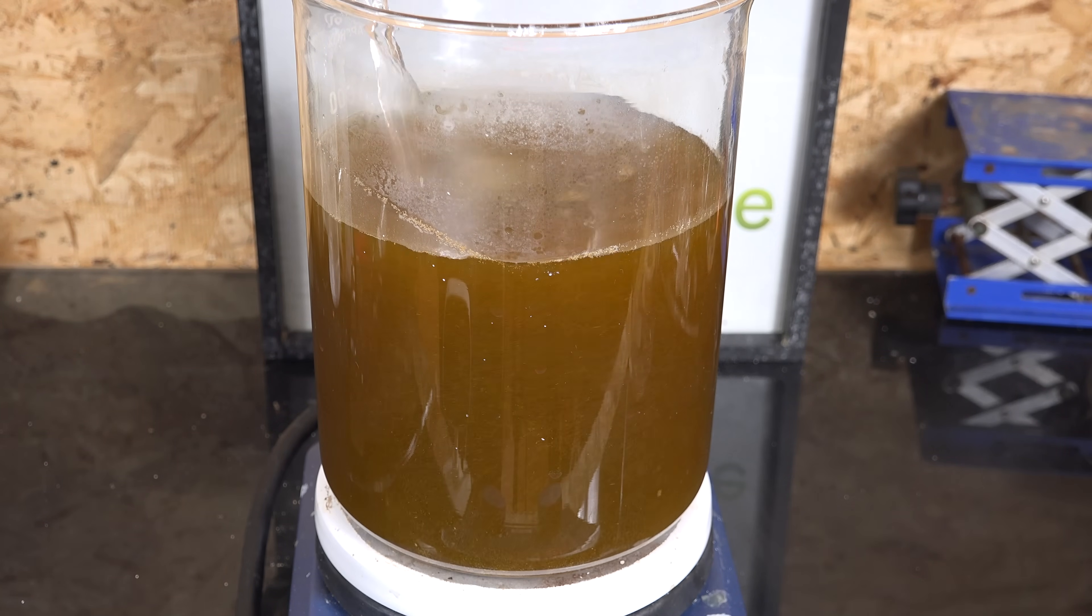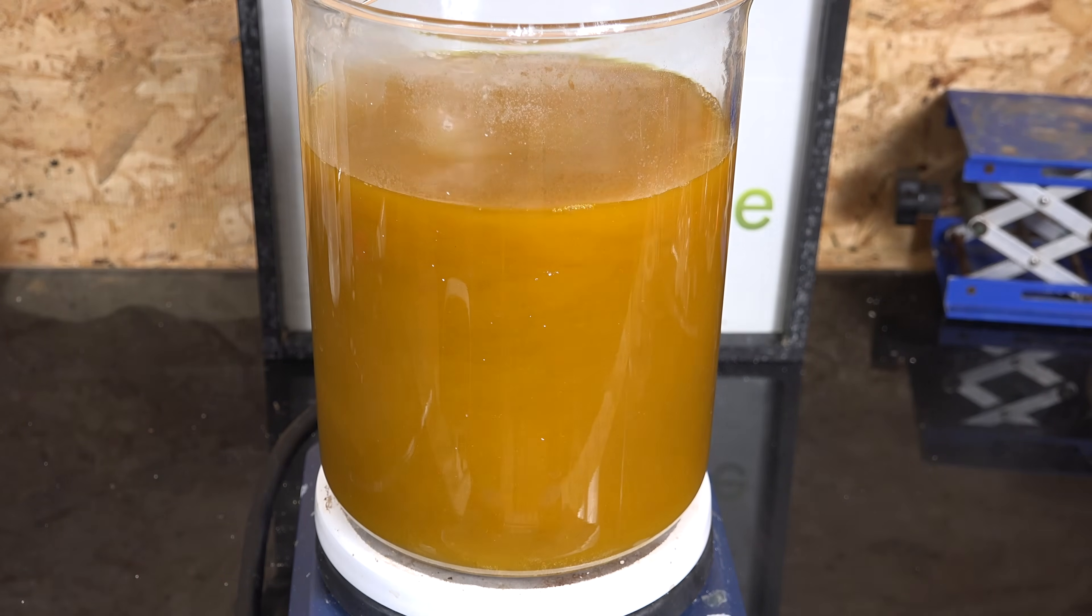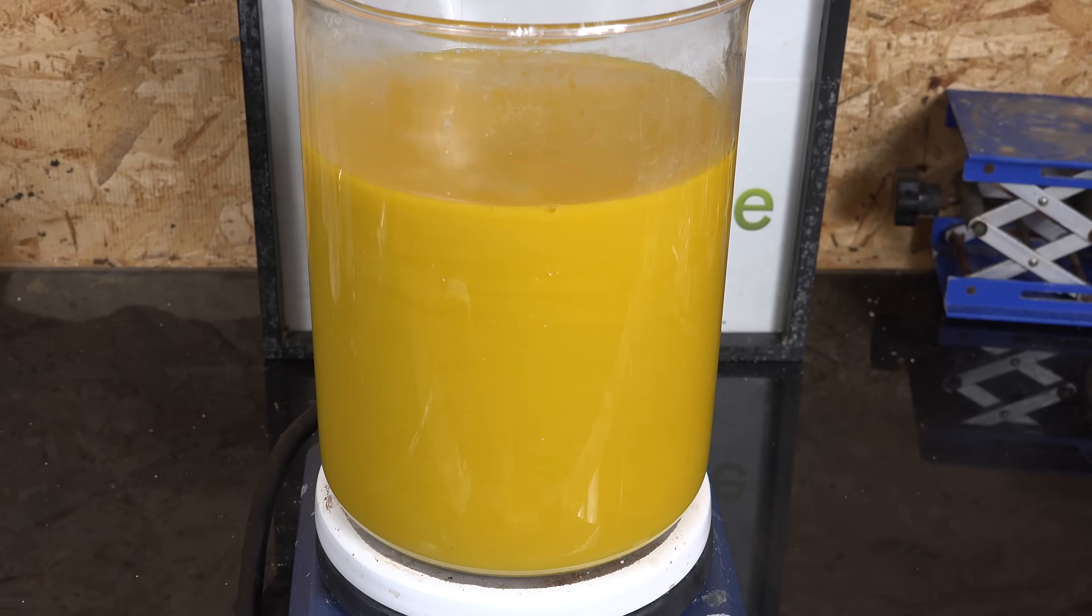The resulting iron(III) oxalate is somewhat more soluble, especially under these acidic conditions. Some amateurs improve their yield considerably by adding a reducing agent like ascorbic acid or bubbling in sulfur dioxide. Perhaps I'll try that in the future.